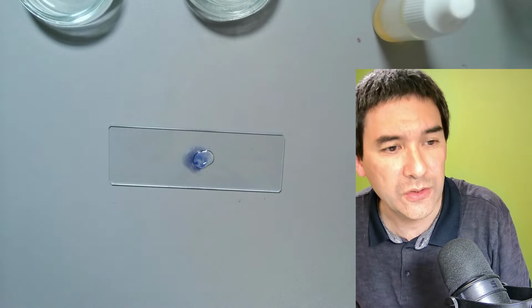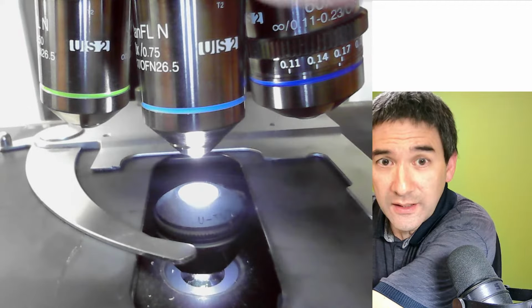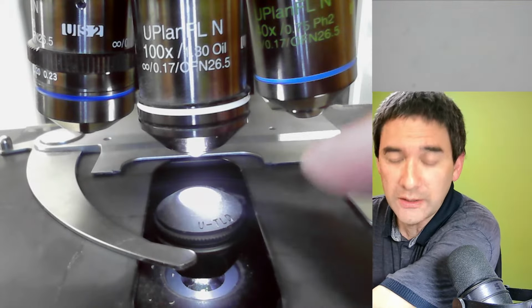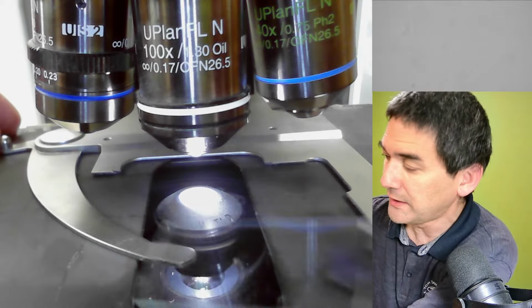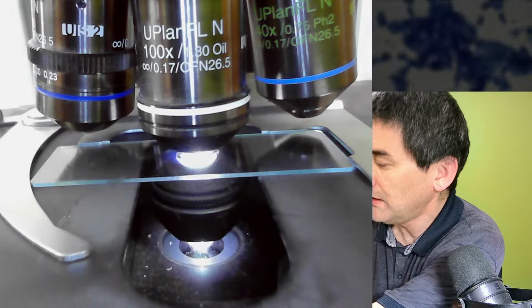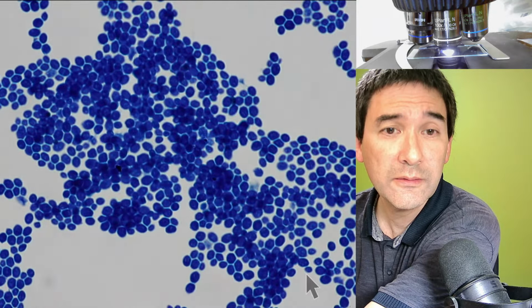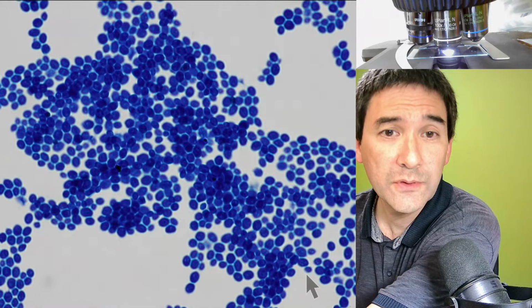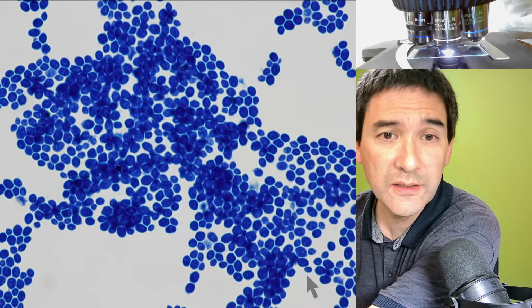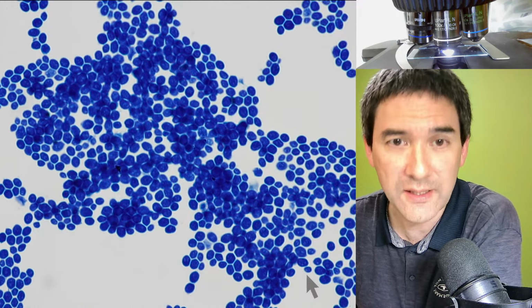I'm going to switch again to the stage view here. I'm going to lower this as before. I'm going to put the oil immersion objective in place. This one goes directly in here. It's got to be centered. I move it into the oil. Okay, and the scope view is here. Let's turn it up, and this is how it looks. Okay, so these are the stained yeast cells, in oil immersion, heat fixed and stained.